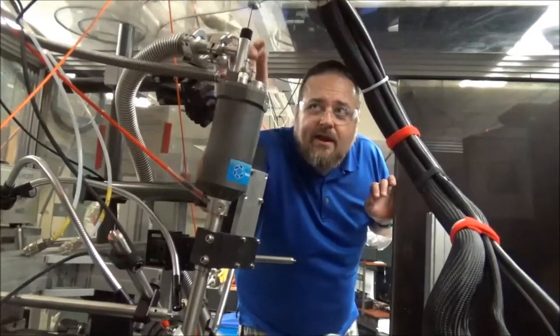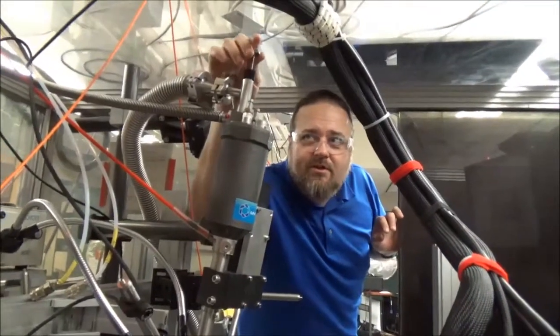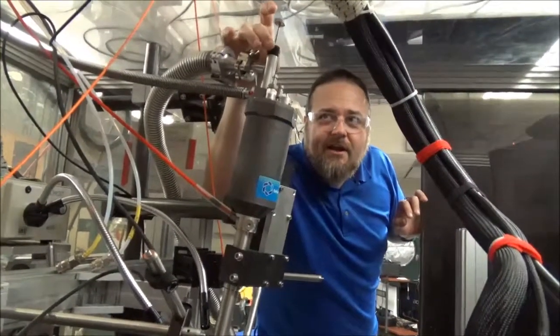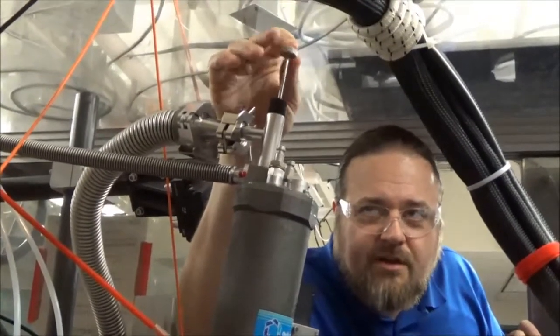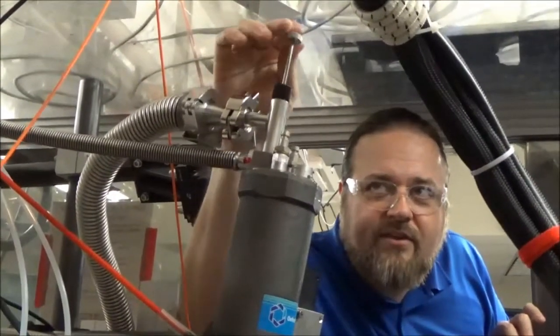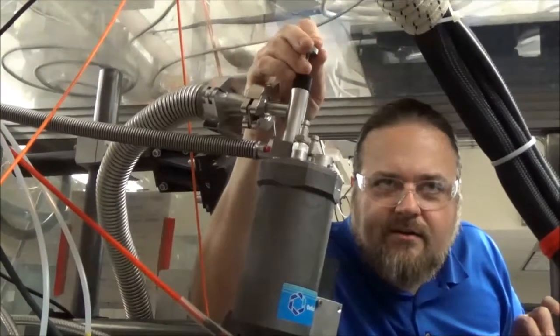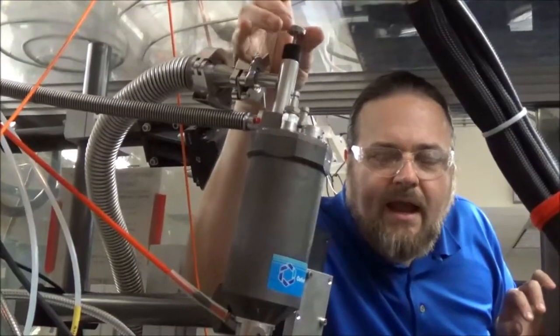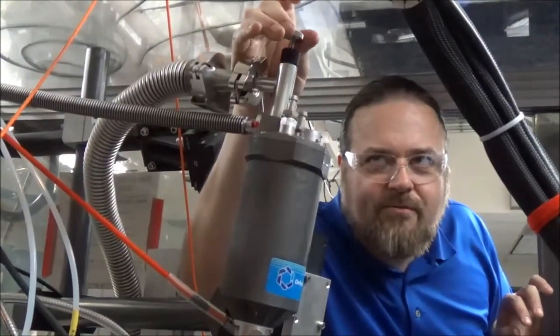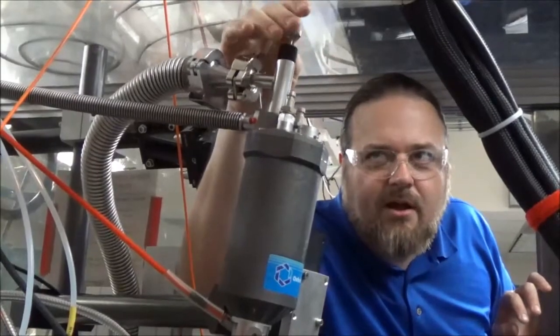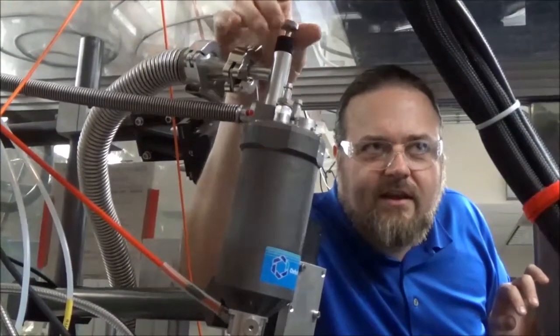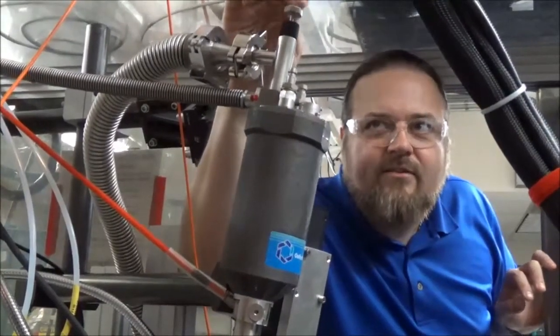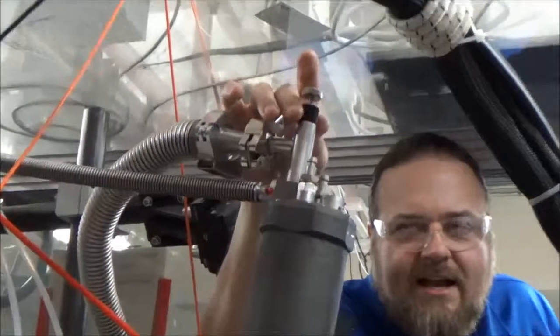There's still a plug right around there. And we're going to engage the plug with this plunger. So the way this works is you have to loosen this black ring here. You have to loosen it slightly so that the plunger can move up and down and there's threads here. You want to be really careful, but you put it in until you can feel it hit something. Then you gently twist it and you have to feel it, but it won't come up now because it's engaging the plug. And you twist it in, twist it in. And there. Now it's a little bit tight. That means this is fully threaded onto the plug that's inside here.